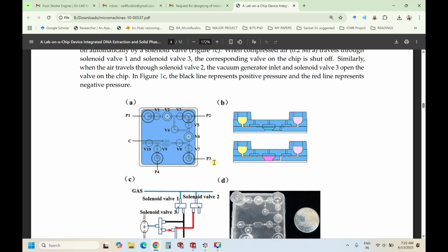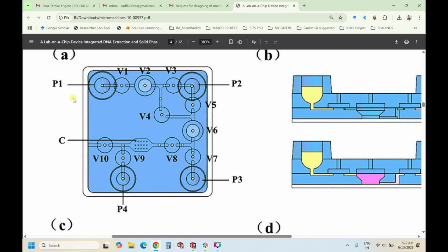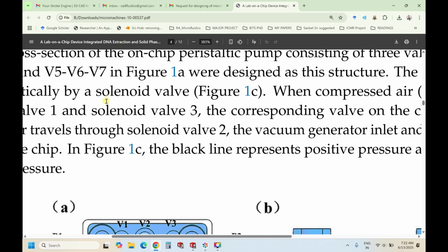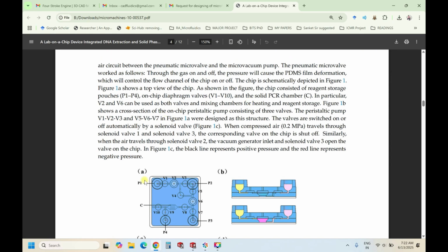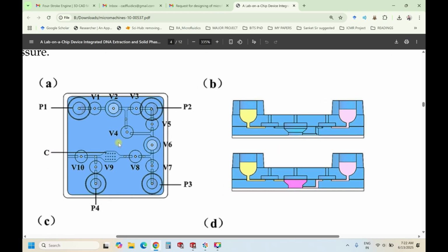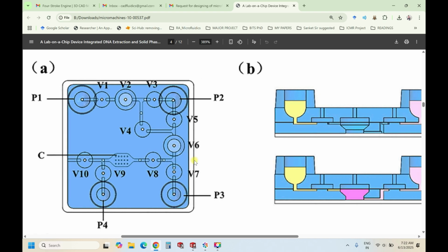So if you look at this chip design, P1 is the pneumatic, I think these are written here. Pouches are termed as P1, valves are termed as V1, and C is the reaction chamber. Just by seeing this channel geometry, we are not sure whether it is in 1 layer, 2 layers or 3 layers. When I went through the article, I found that there is some complexity involved.